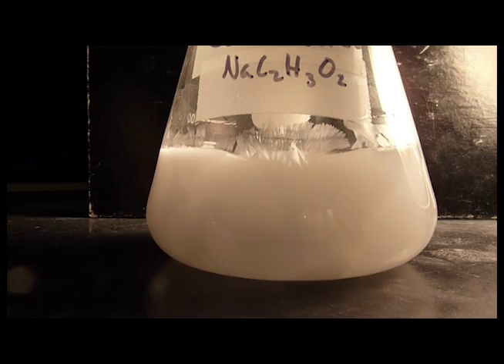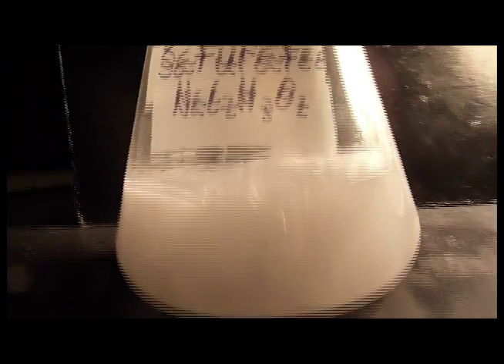This is pretty interesting. If you take a look at it, you can see the sodium acetate crystals inside that have formed.